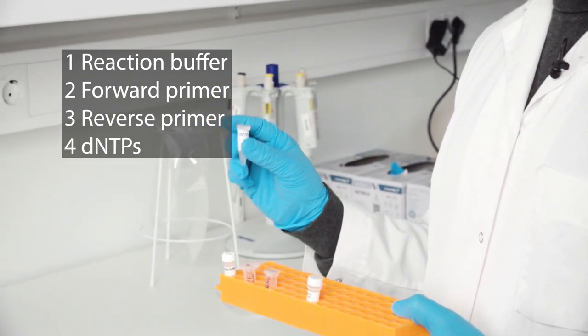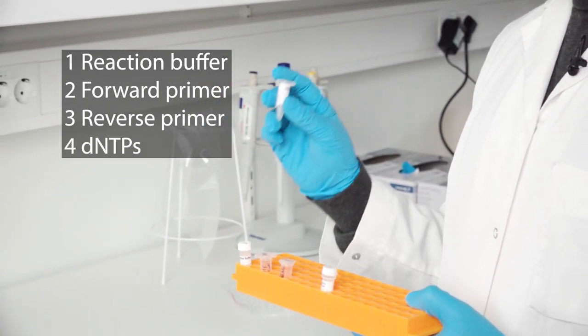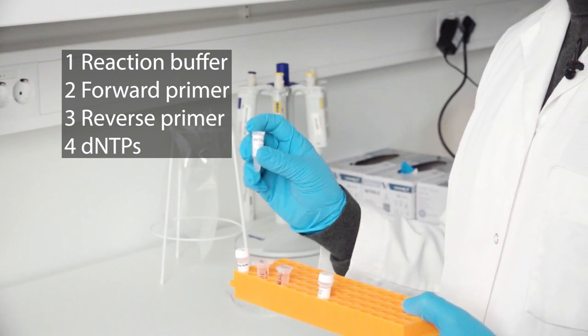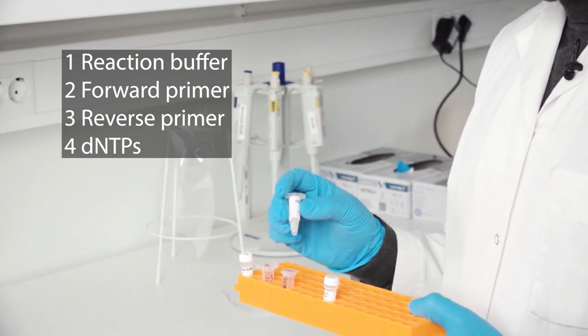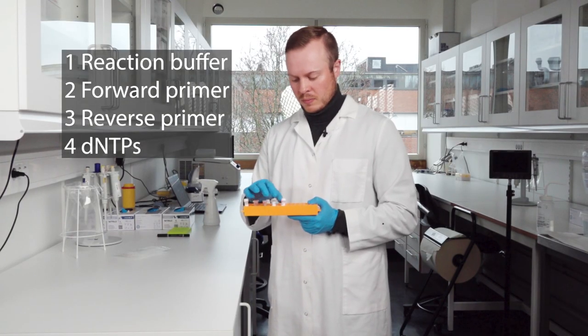And then we have the dNTPs, and the dNTPs are mixtures of all the bases that is required for the PCR process and the amplification.